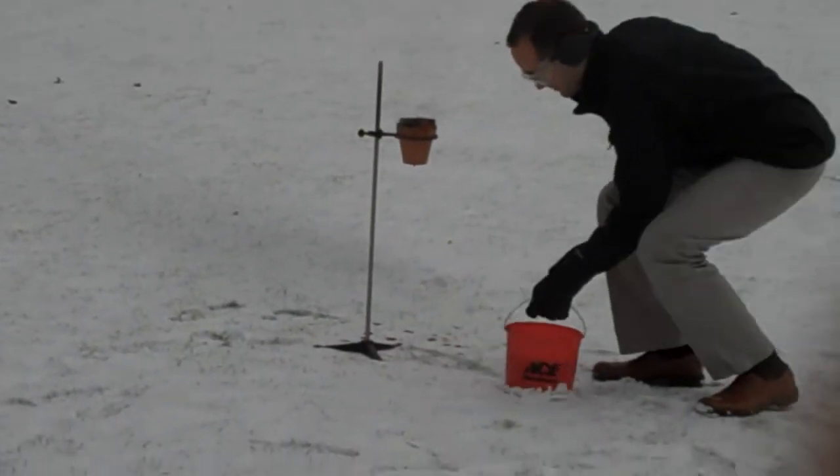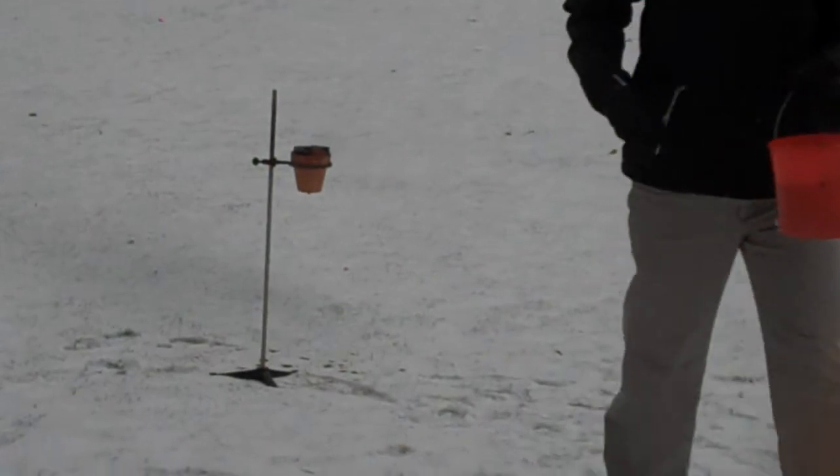This is going on YouTube. Now, if your hands are cold, take your gloves off, and you can actually put your hand close to this. This is molten iron. Careful, don't touch it — it's very hot. It's still sparking a little bit.